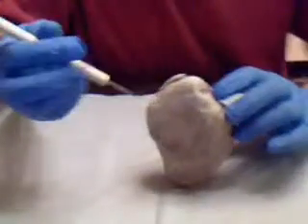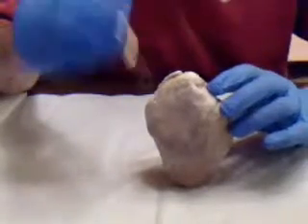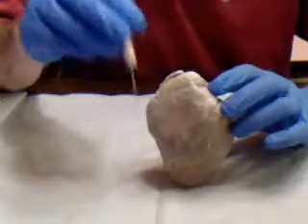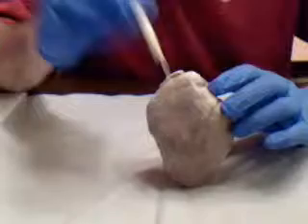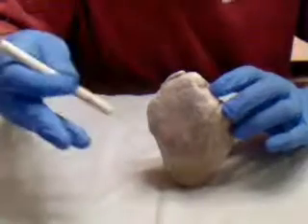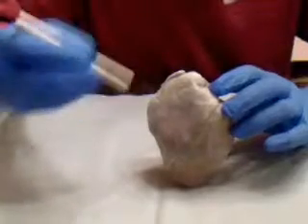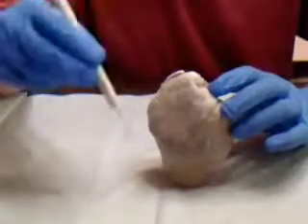The pericardial sac has already been removed, so I'm going to go ahead and talk about the three pericardium. There's the fibrous pericardium, which is the most superficial layer of the pericardium, the parietal pericardium, which lies between the visceral pericardium and the fibrous pericardium, and then there's the visceral pericardium, which you see right here. It's also known as the epicardium, and it's the outer layer of the heart tissue.